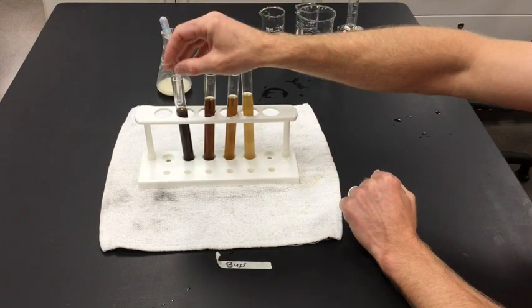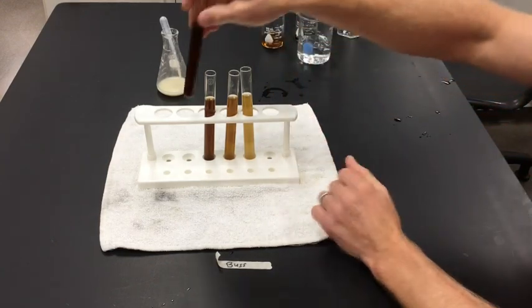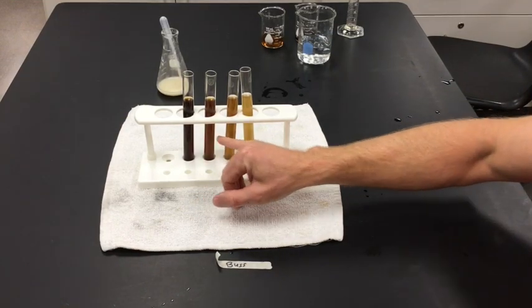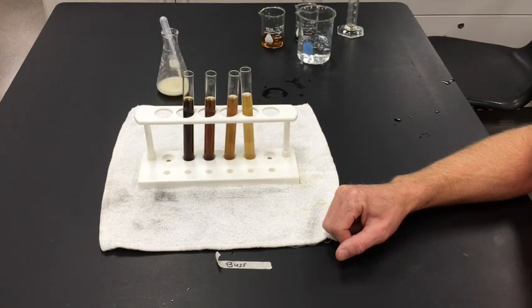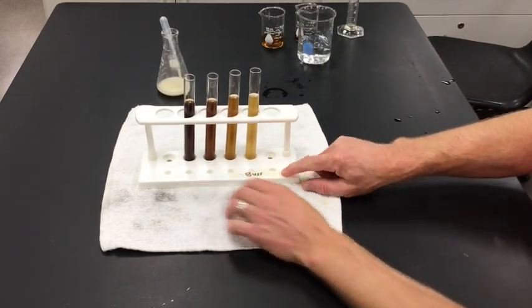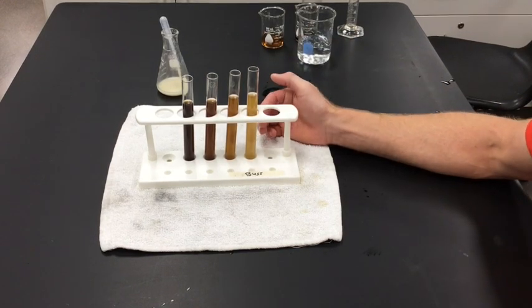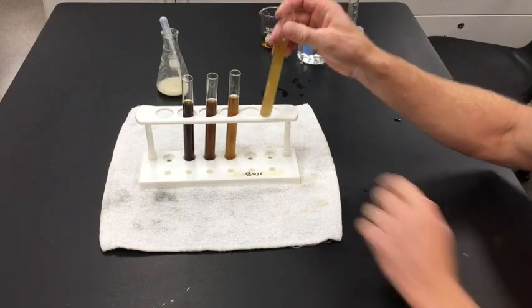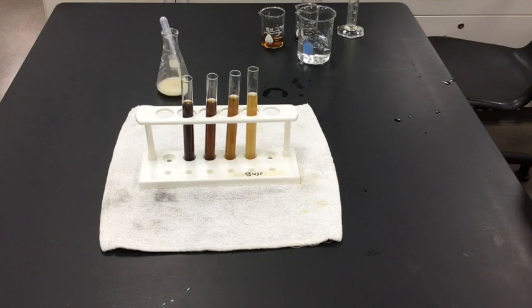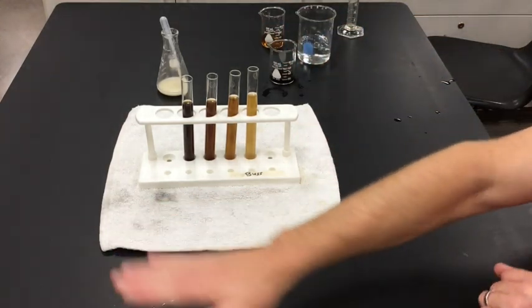The experiment is set. I have different concentrations of molasses but equal volume, and the same amount of yeast in each — it's going to be at the same temperature. My independent variable is the amount of molasses. Make sure you have labeled each tube — take a piece of tape and marker and put a label on the test tube rack so you know it's yours. Set it aside overnight; the yeast will be active, consuming the molasses potentially at different rates, and you'll come back tomorrow to see how much gas was collected in the upside-down test tubes. Clear off your table, rinse your beakers multiple times with water and return them clean, and wipe off and spray your table as well.